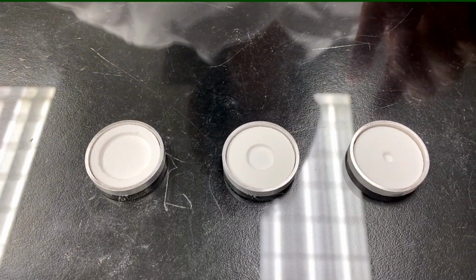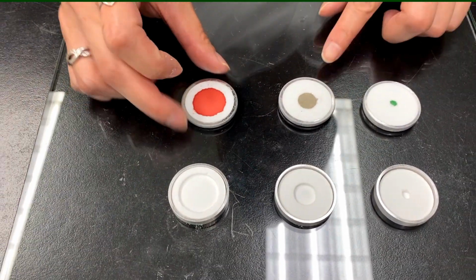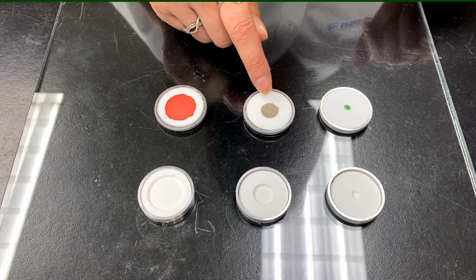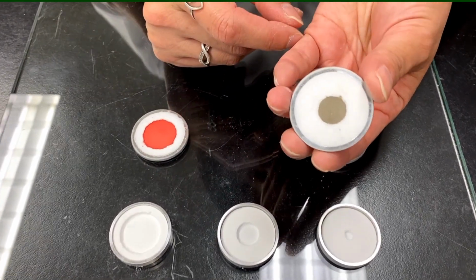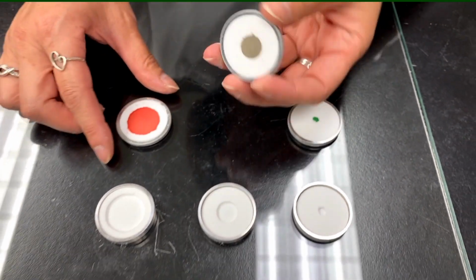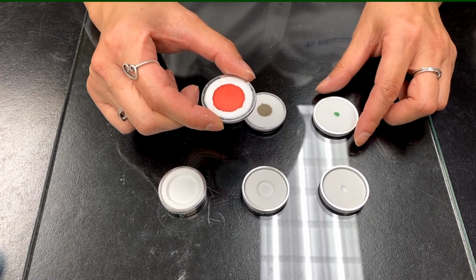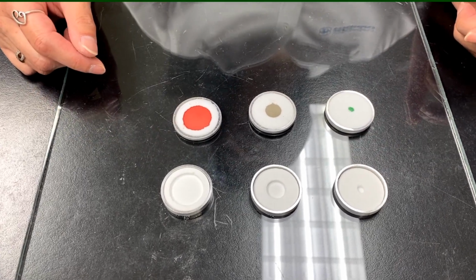It's the same way. You press it with the pancake press, and once it's pressed, it will look something similar to these examples here. You can analyze these directly without a film, and they do hold the sample in place, and you don't have to put any binder to dilute this down. So these are very simple to use, to make, and you can also recover these samples back. And that's what we use for our carbon, nitrogen, oxygen analysis. Right, exactly, so that it can look at just that sample. If you had a sample that needed a little bit of binder, this provides that support without having to have binder mixed in with your sample.